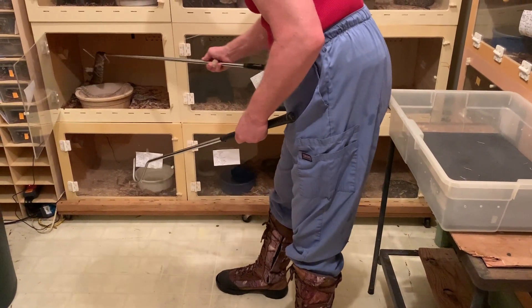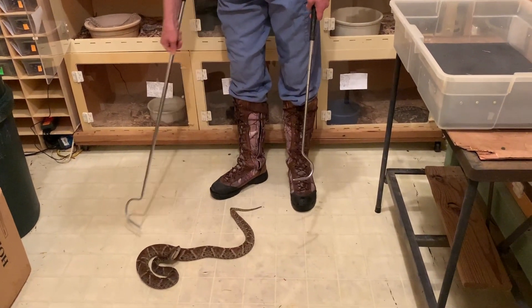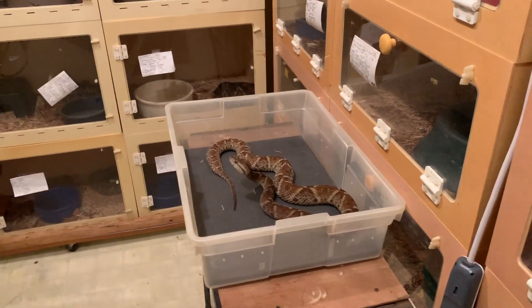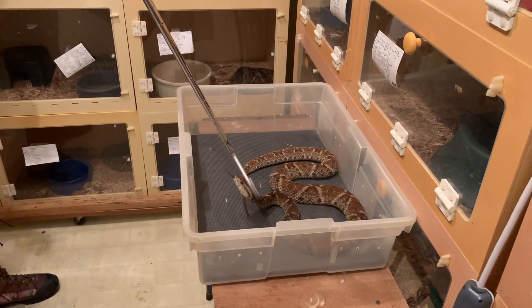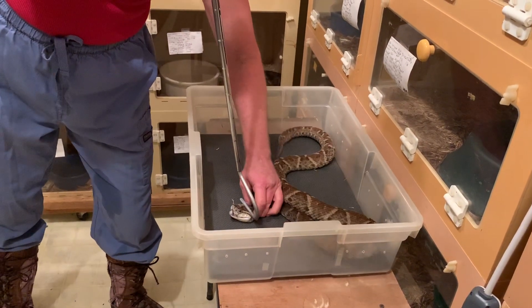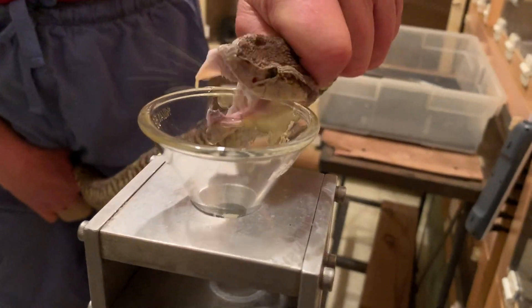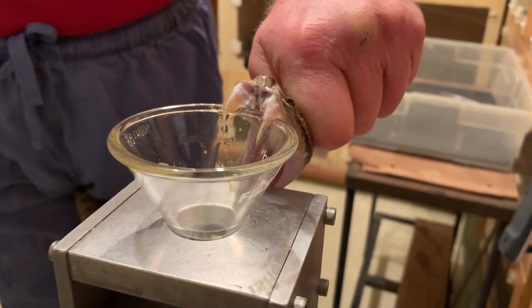I don't know if you guys caught that little strike. This one is one of the more reactive ones we have, so Jim's just going to try to move really slowly to try to keep her calm if we can. You can see in comparison to the other one, she's very high alert. She really bit that — and these guys really do have very large fangs. I think you can see that right there.